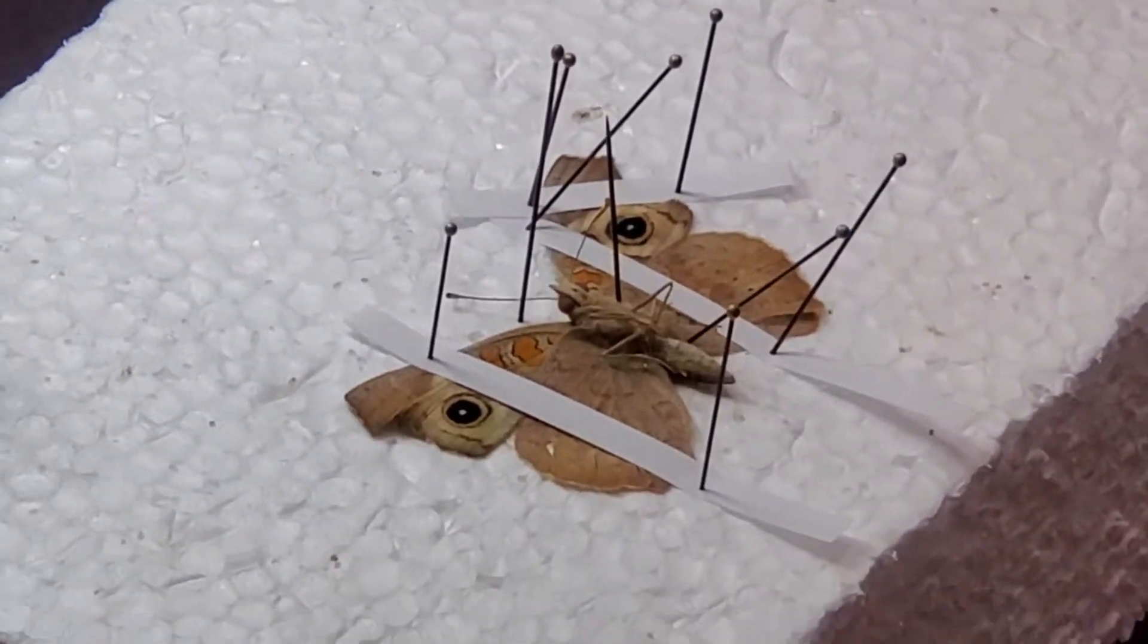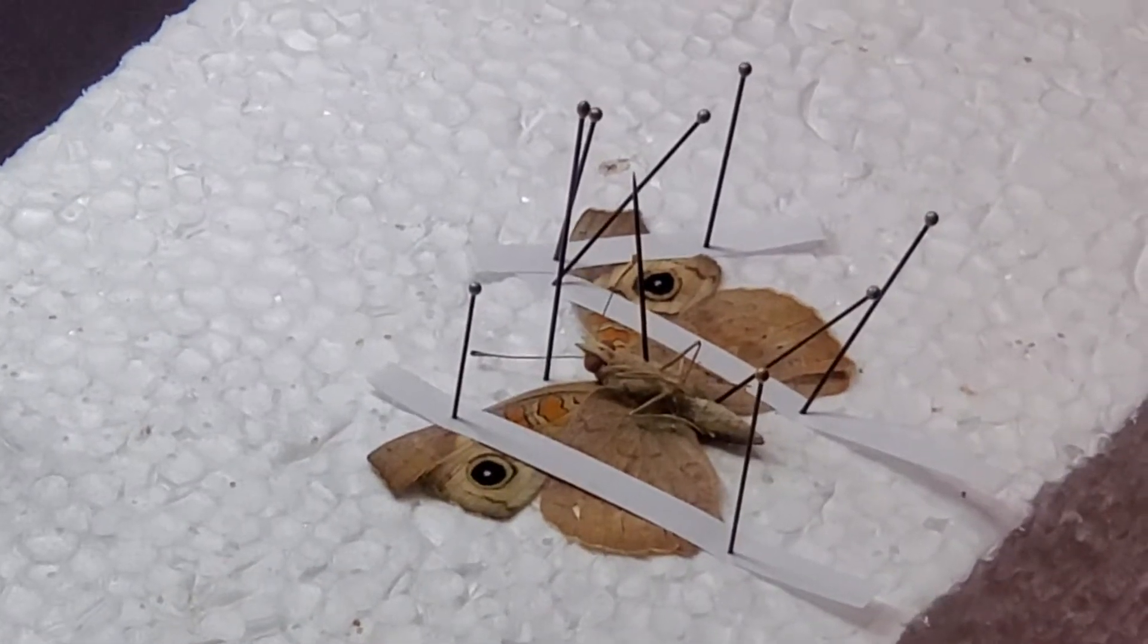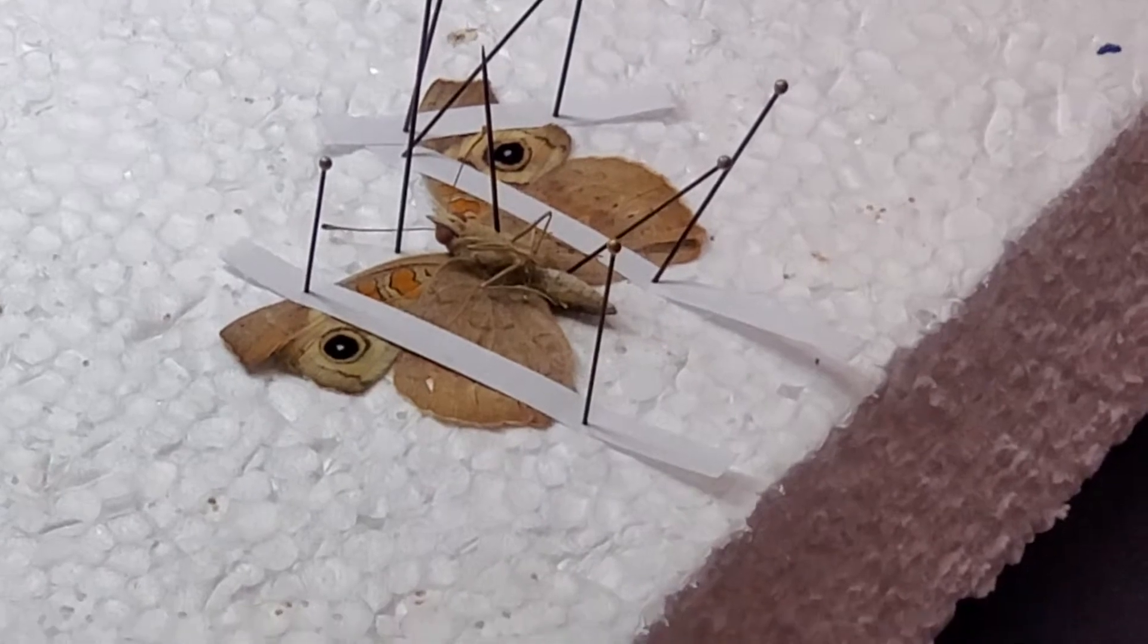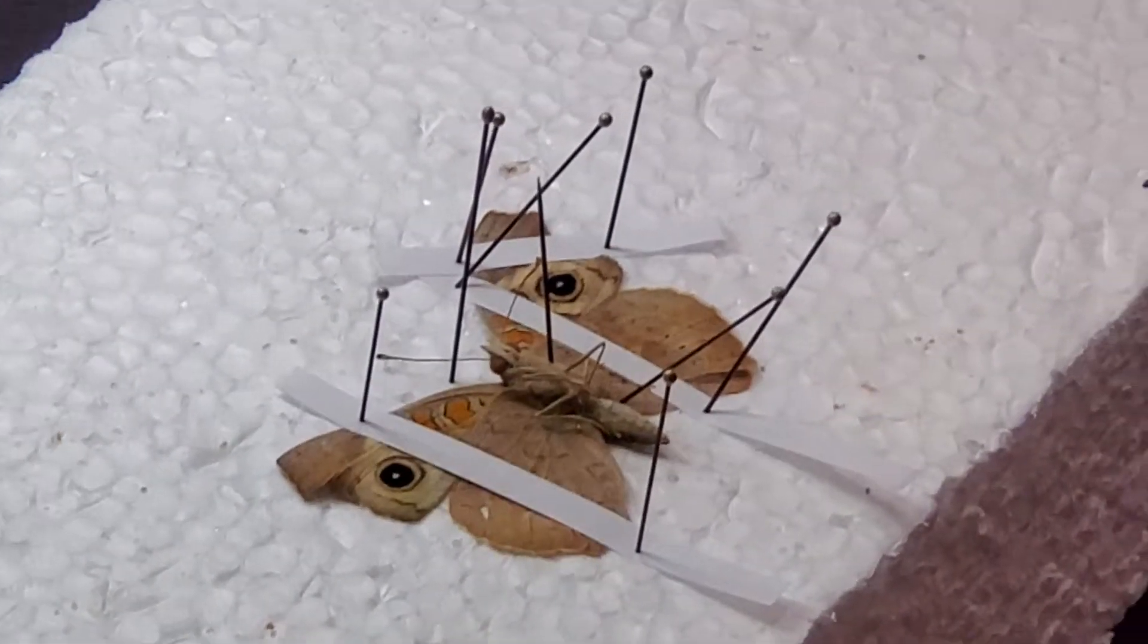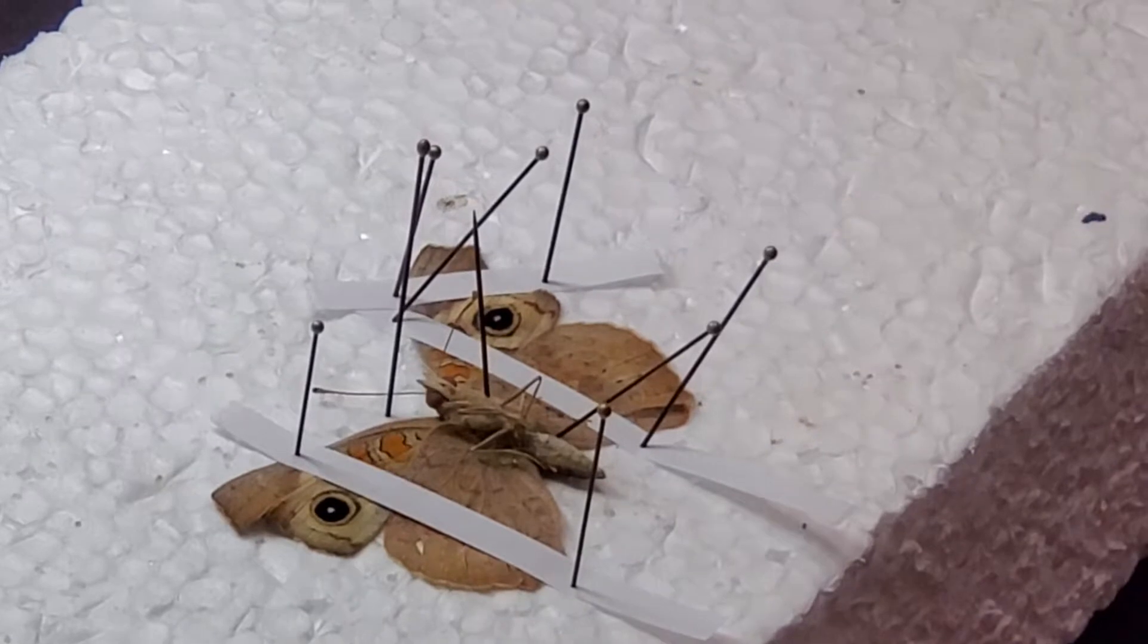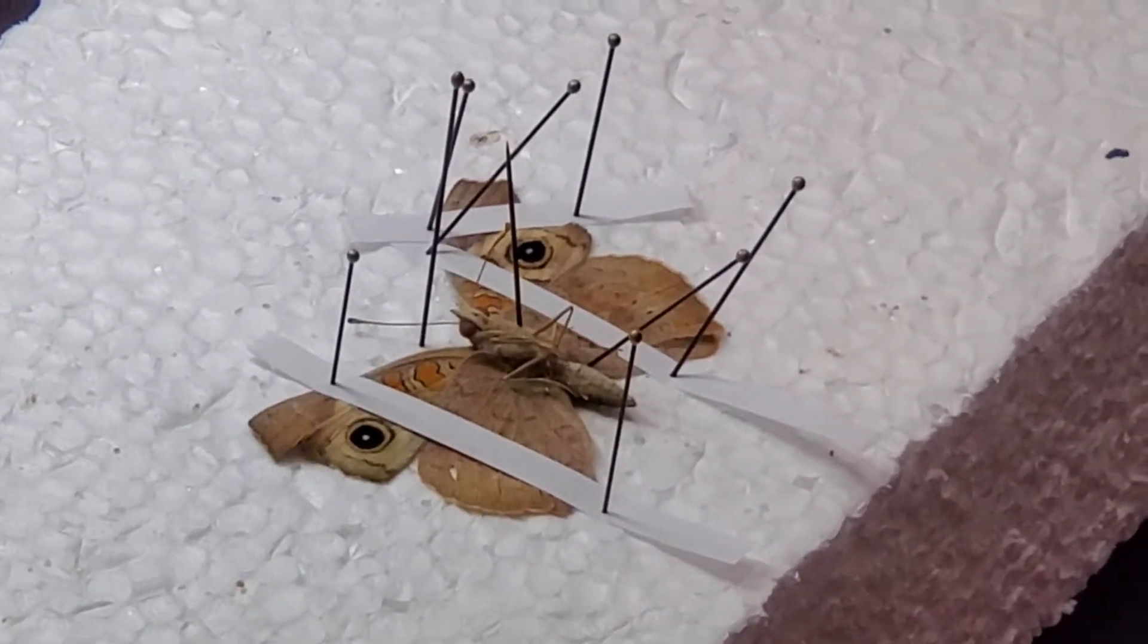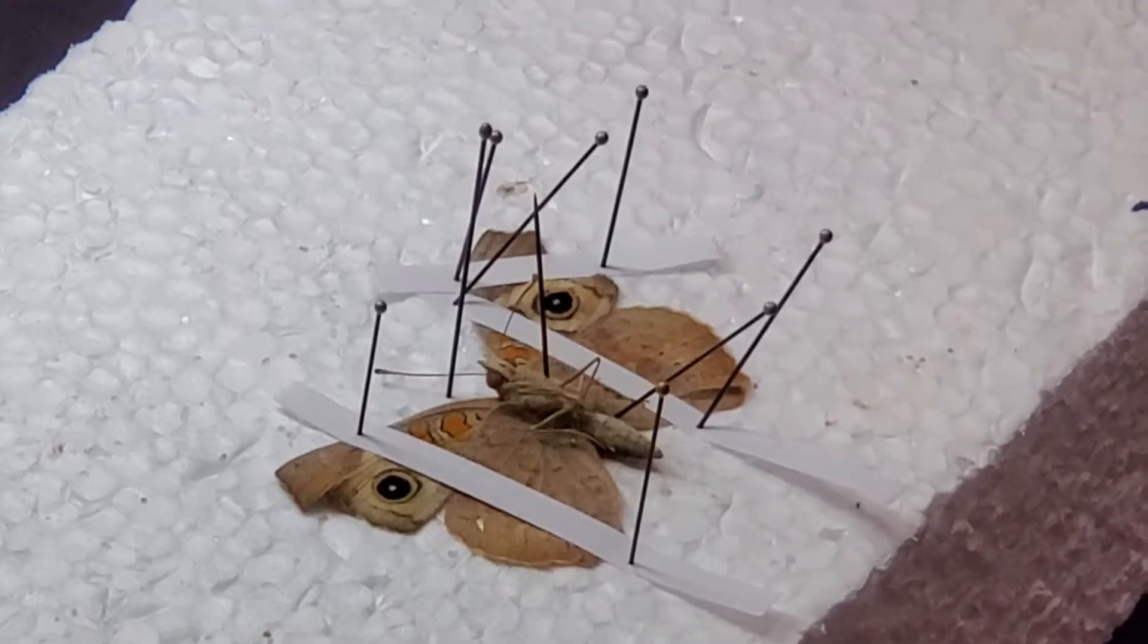How many pieces of paper and pins should I use? For my own collection, I normally would use a minimum of four pieces of paper. This would be the minimum. Maximum might be over a dozen. How much do you use? As many pieces of paper as it takes to hold everything down secure.